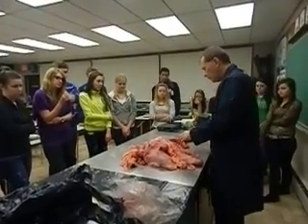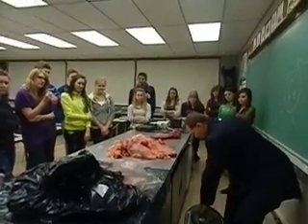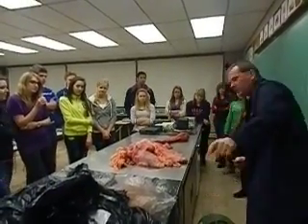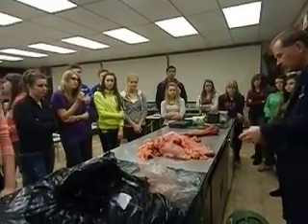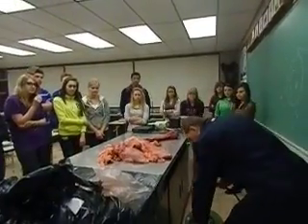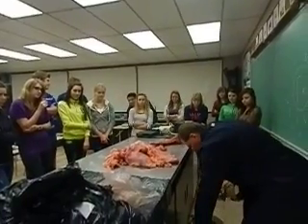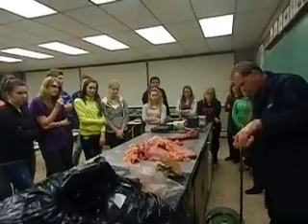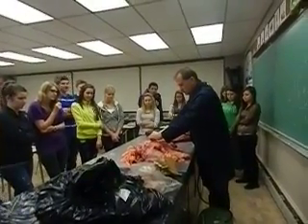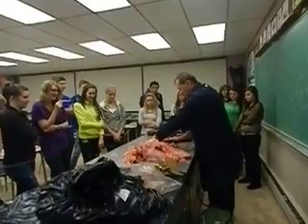I think the next thing I want to do is introduce some air into here. I'm going to bring my air tank — I filled this up with 140 pounds of pressure. I'm going to put it in here. Okay, time to inject some air. I'll just start with this little guy right here — who knows where he goes. Let's see if we can inject some air.